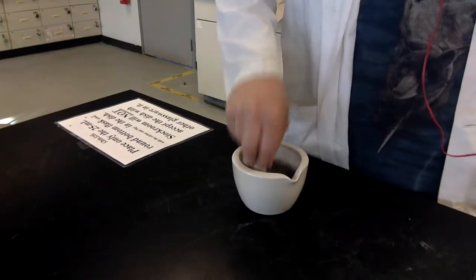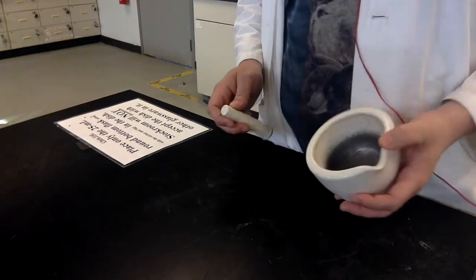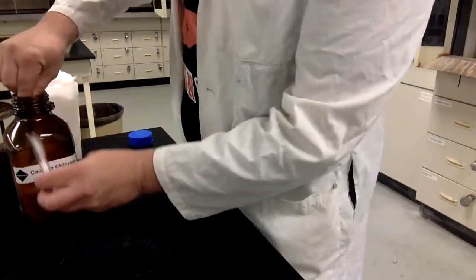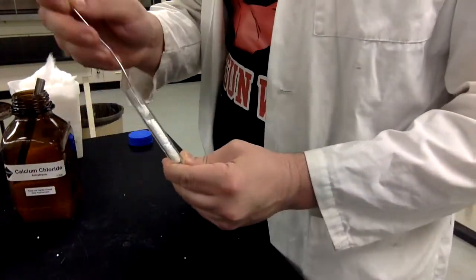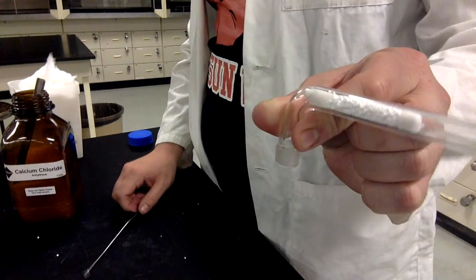Because of that, we had you crush the magnesium last week, and then we stuck it in an oven so it'd boil off all the water. As an additional precaution, we'll be using a drying tube again. Remember, cotton ball, two to three fingers worth of calcium chloride, and then another cotton ball. Just like that.